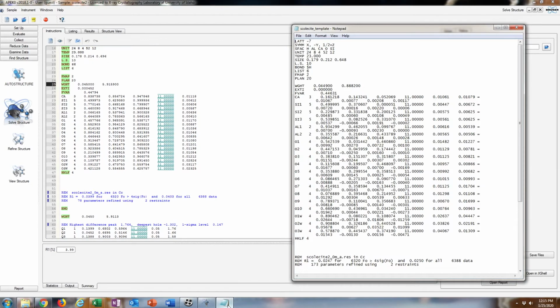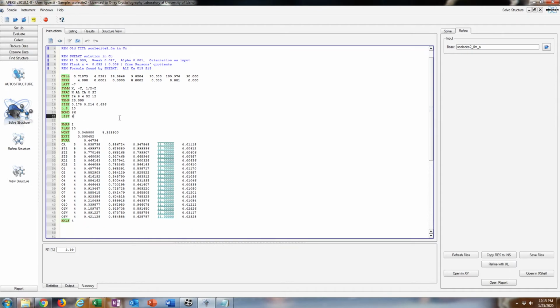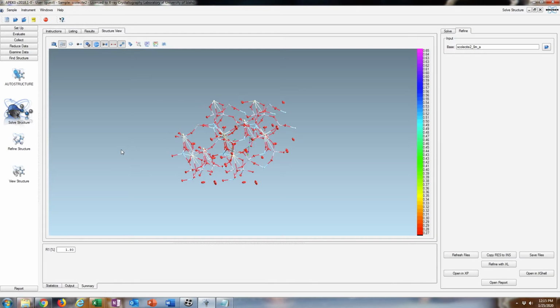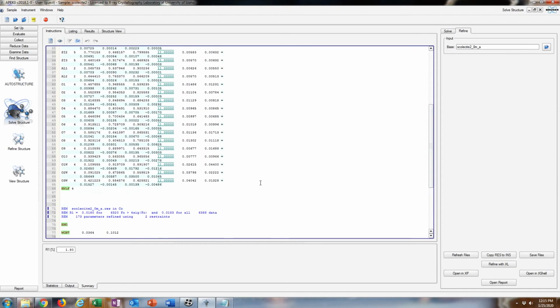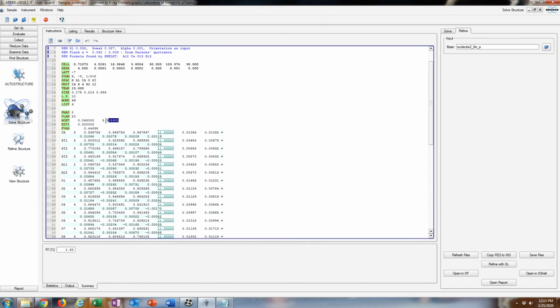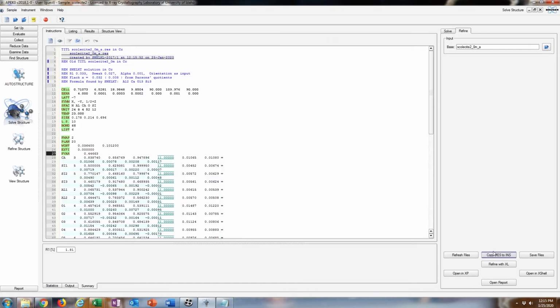Now we want to go anisotropic, I'd say. So we're going to use anisotropic thermal ellipsoids because, you know, at room temperature the atoms are going to have a little bit more displacement than in this model. And that will drop the R quite a bit. So now we're sitting at 1.8%. It's going to change the weighting scheme. Going to change that. And copy res to ins. Okay.